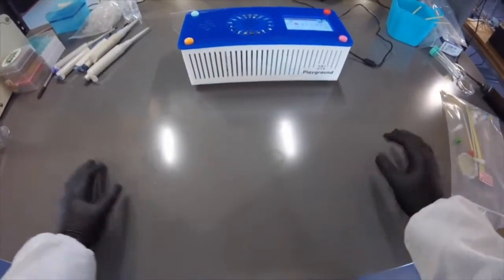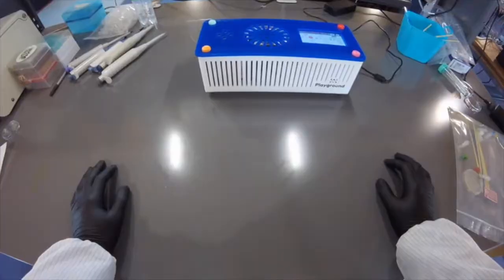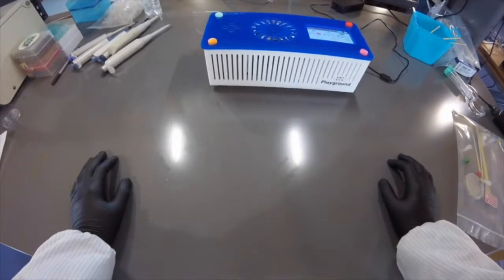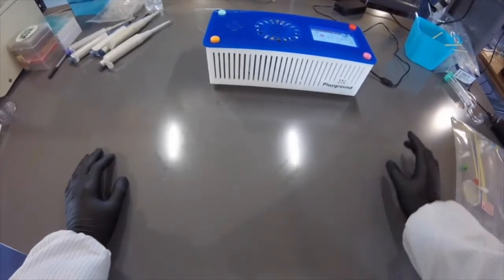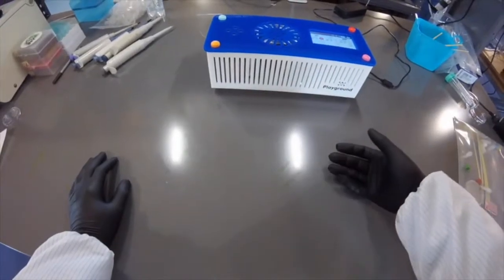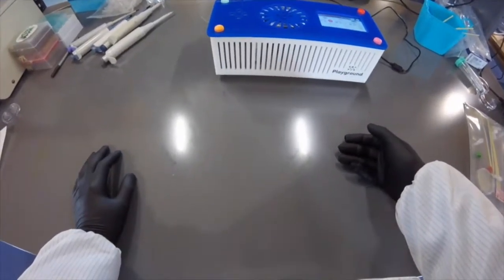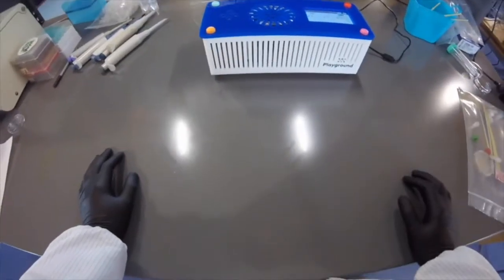Hello everybody. It's been a couple of days since we did our transformation, and after about 24 hours I changed the temperature to 30 degrees Celsius. I'll just turn that off now.